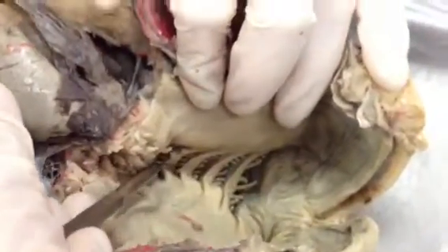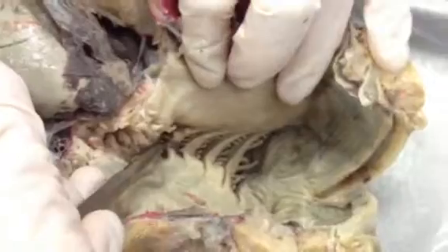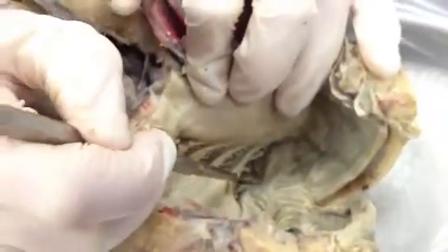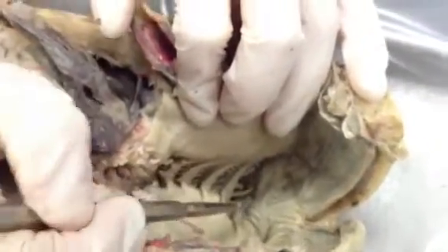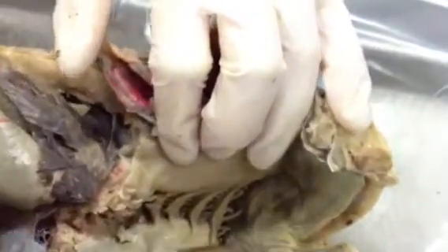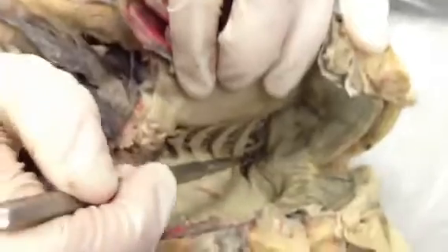You'll also see the internal gill slits here. And then the little protruding structures of the gill rakers — those prevent food from entering the gills. And then the branchial pouches: whenever you keep going into the internal gill slits, you'll have the branchial pouches.